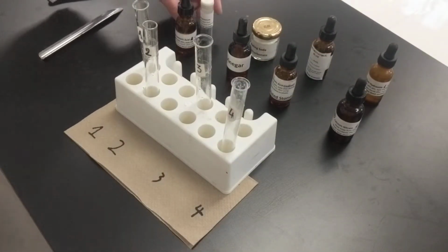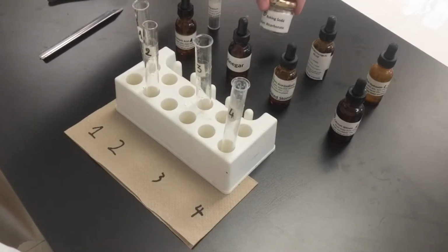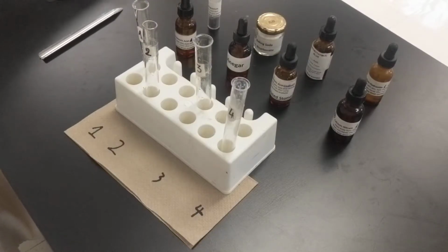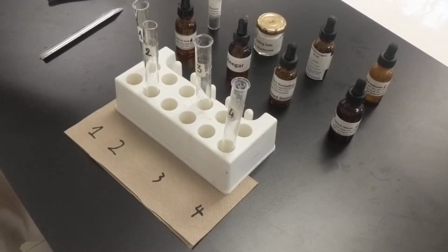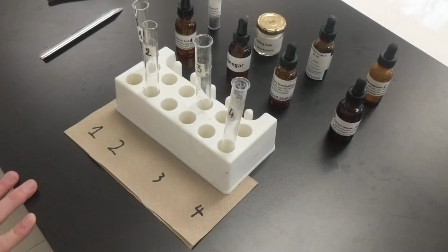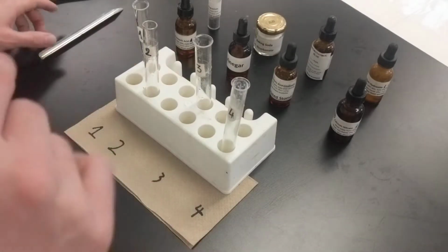This is sodium hydroxide. So those are all liquids. Now for the solids, we have magnesium. We have baking soda, or sodium bicarbonate. We have aluminum chloride. We have Alka-Seltzer, which it doesn't say here, but anyway. And we have calcium hydroxide as well. Okay, so that's step one, and you should be listing all those things. You can pause it now if you need to, or rewind.